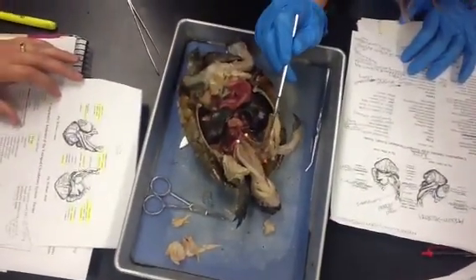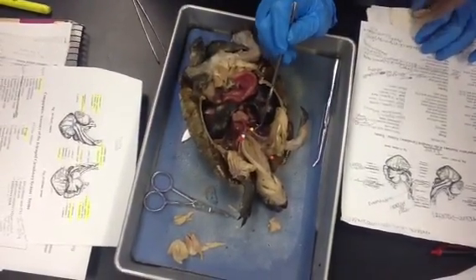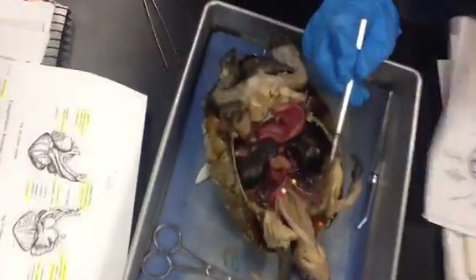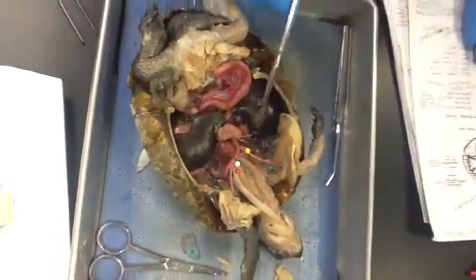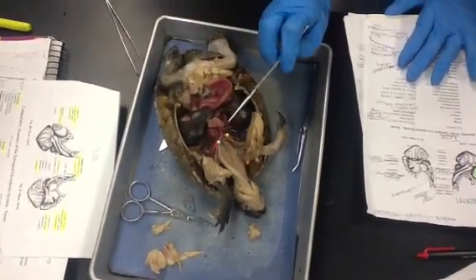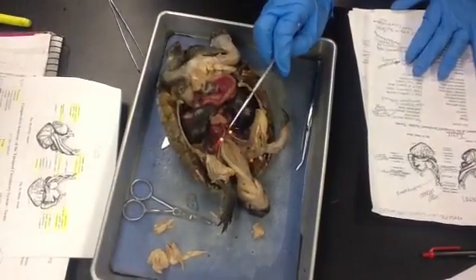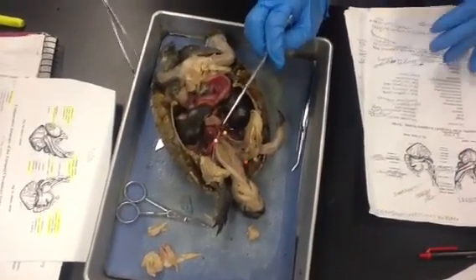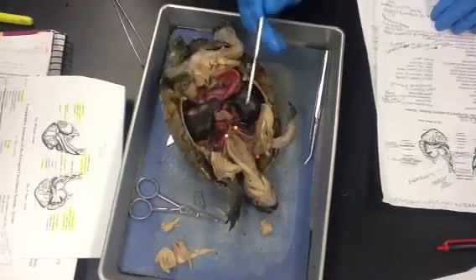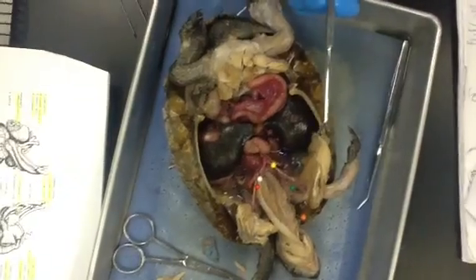The green pin up here is the subclavian artery. The subclavian artery comes out of the brachiocephalic artery. Starting from this portion down here, right next to the yellow pin, it's an artery that's right there. At the base where it separates — like a T, or a trunk — where the V is, that's the brachiocephalic artery, where a branch is at the bottom. The brachiocephalic artery is coming out of the right systemic trunk.